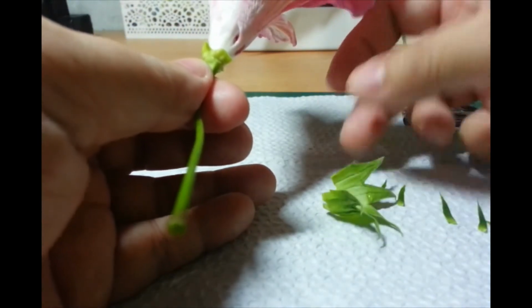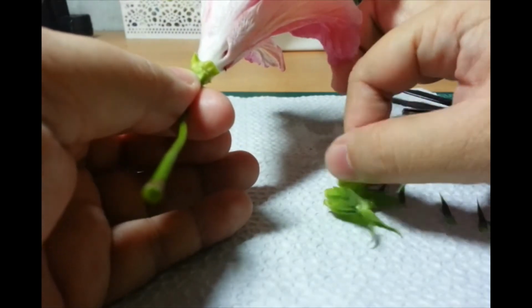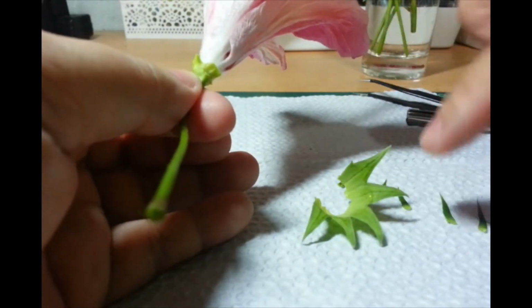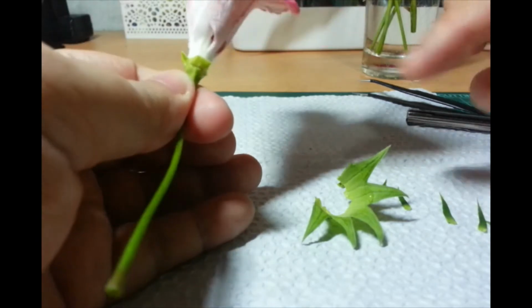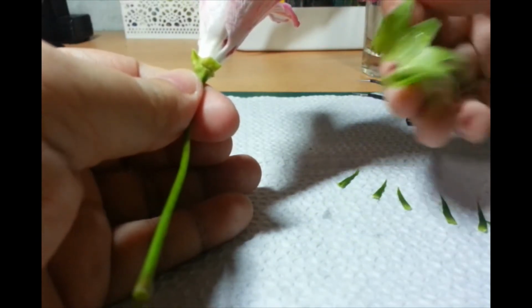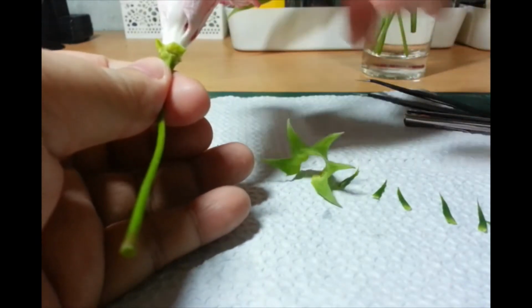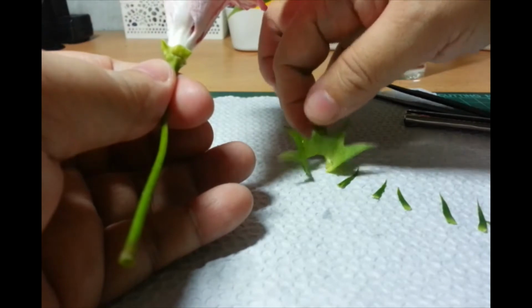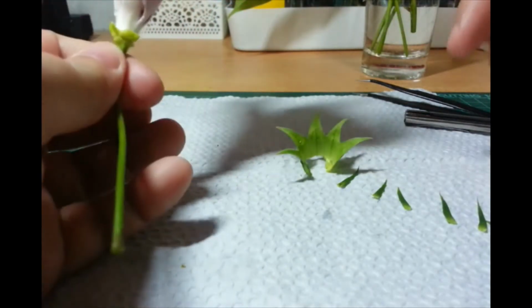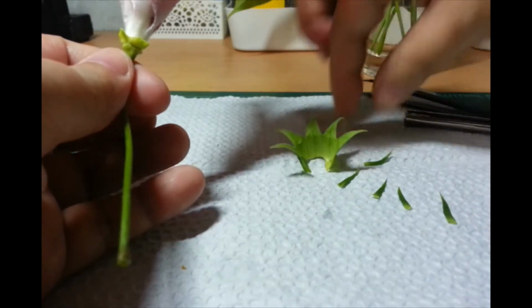So, that liquid is sweet. I just tasted it. Okay. So, that's the nectar. If you can see, may nectar pa siya. Maya-maya, mai-encounter na natin yung mga langgam. So, this is the calyx. So, collectively, that's called the calyx. Yung lahat ng sepals all together. And then, earlier, we had the bracts.